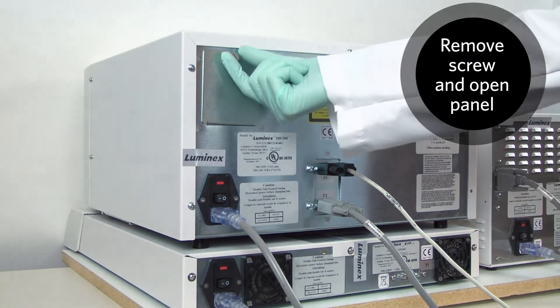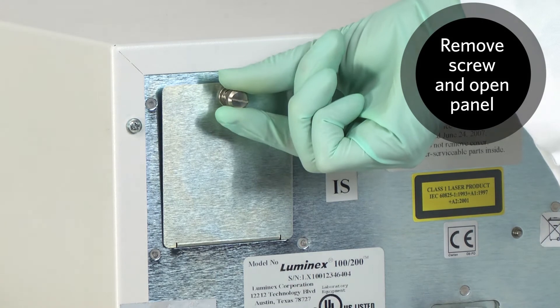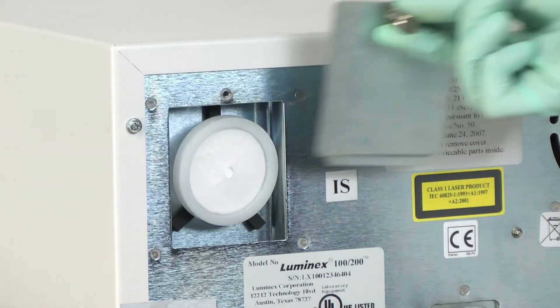Remove the screw at the top of the panel. Open the panel door and set it aside.